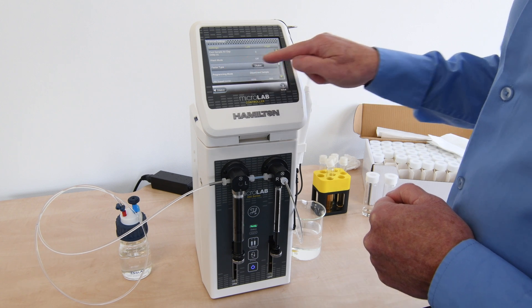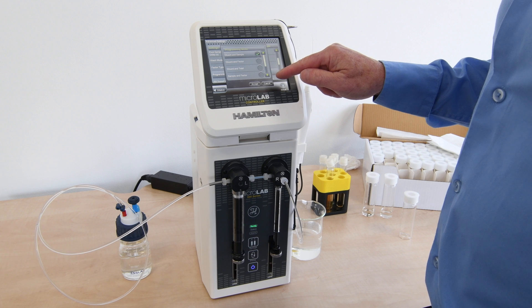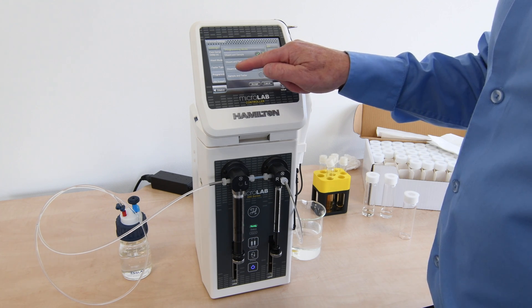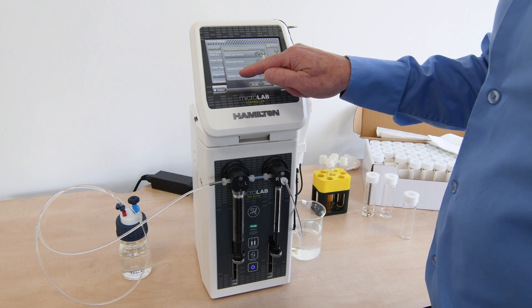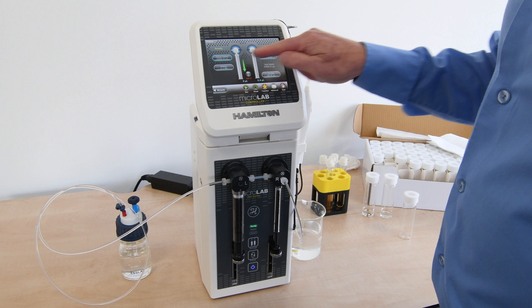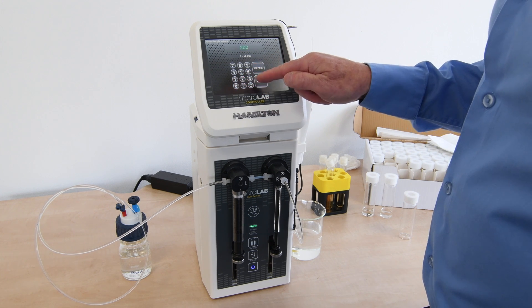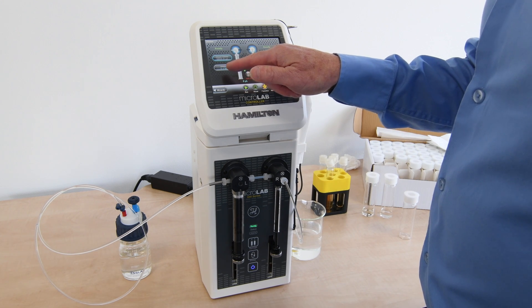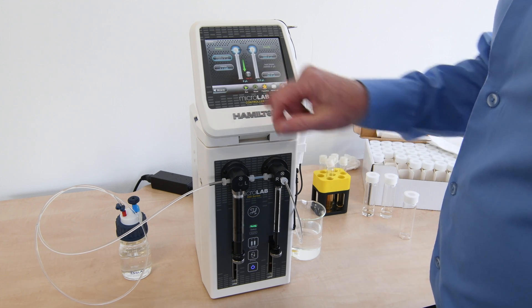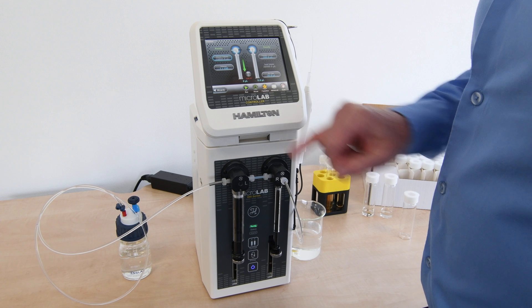The next point is the programming mode itself. We were working with diluent and sample, but I can choose to work with a range of other options, such as sample and factor. Selecting sample and factor and going back to the dilution program now gives us an option to change these variables. I can change the sample to 200 µL, then change the dilution ratio to 1 in 100, and automatically the diluent volume is adjusted in relation to the sample and the dilution.